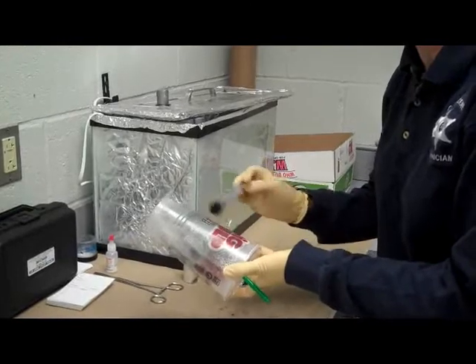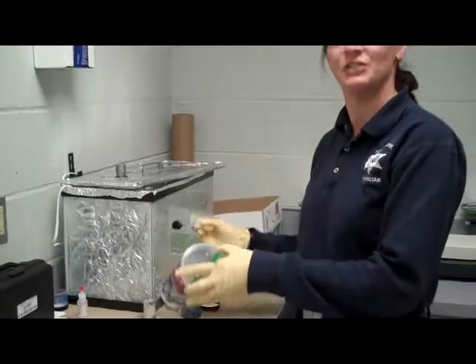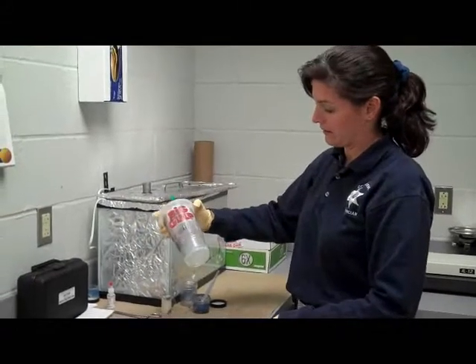They'll have it as an option, because conventional powder still does work better on certain objects such as glass and different surfaces, but plastic like this just loves magnetic powder.